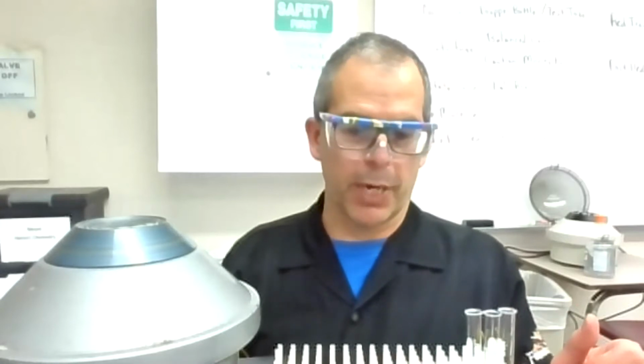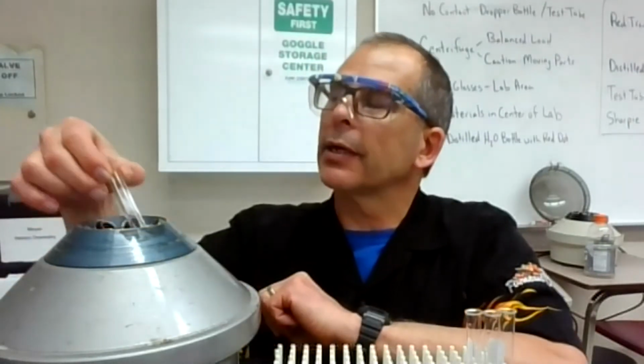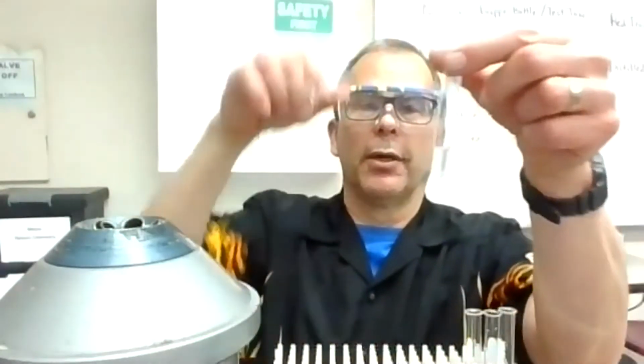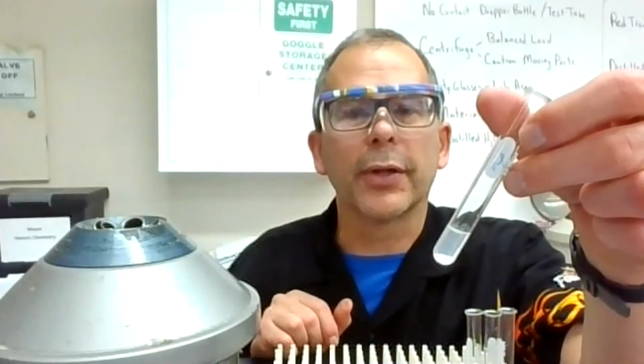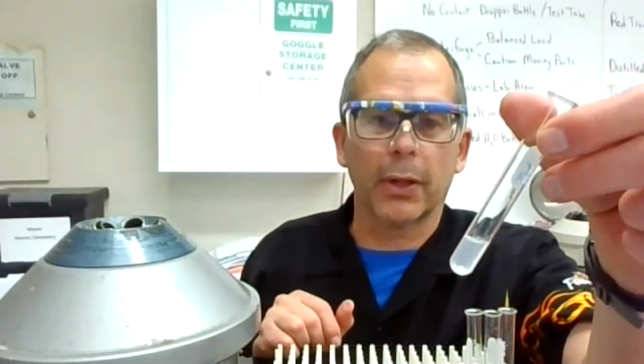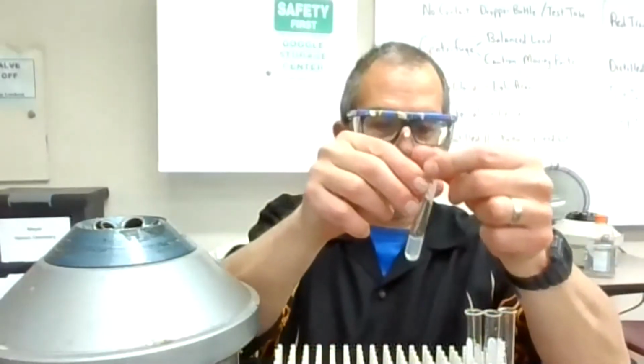And I'm just going to try to make sure I get all of that out. So I'm talking a little extra long. I want to spin that pretty good. And then I'm going to go to this next piece right here. Okay, so I'm going to slow this down, making sure my hands don't come near where that test tube is. And let's see how that spun out. Pretty good. Sometimes it's really cloudy and it's hard to tell. There's a little haze there, but most of it's on the glass. That should be pretty good. And there's definitely a solid stuck to the bottom.